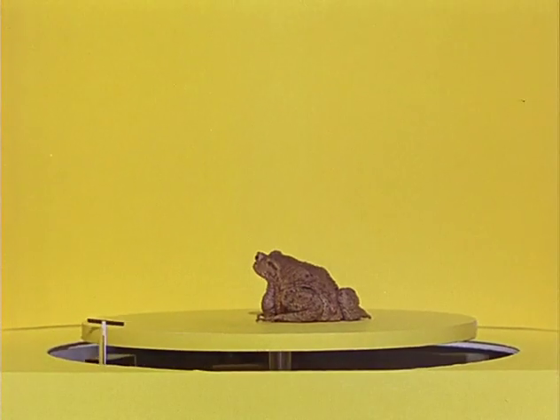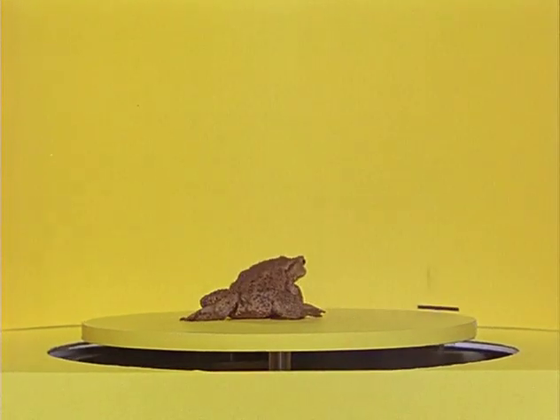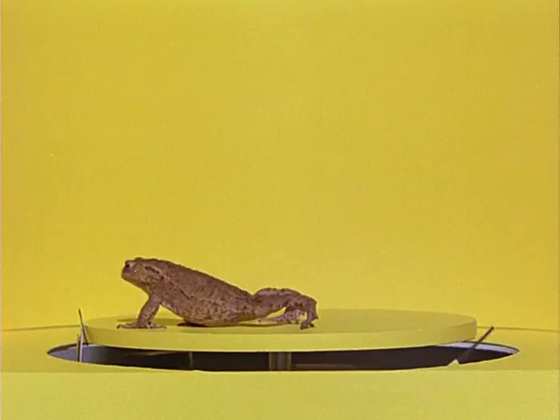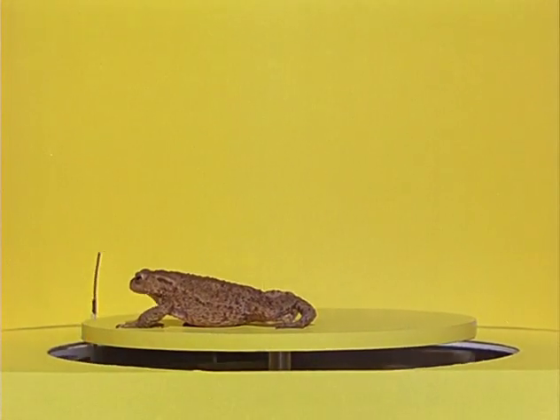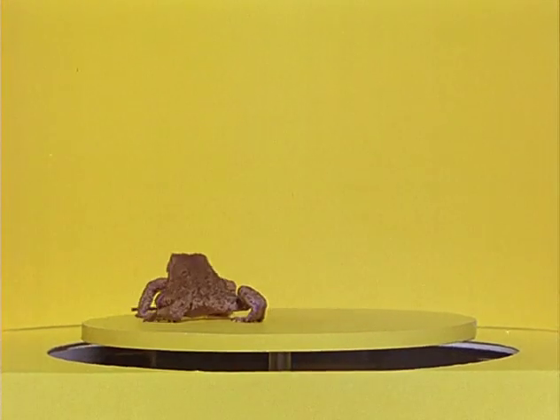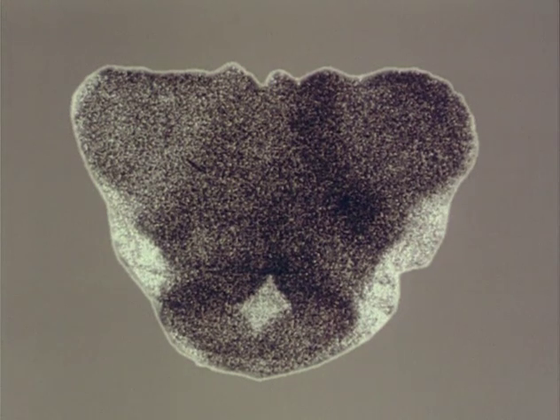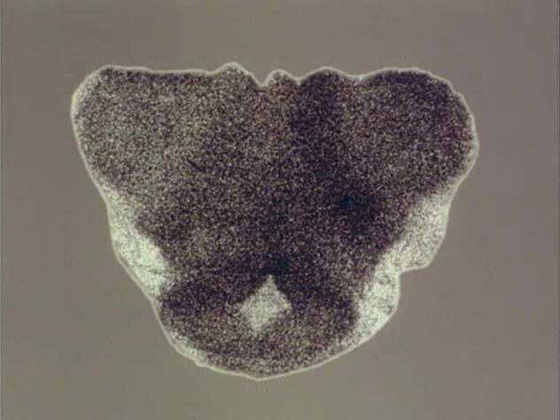There is a method that allows one to check whether visual stimulus patterns evoke different neural activity patterns in the toad's brain according to the hypothesis. If carbon-14 labelled 2-deoxyglucose is applied to the animals, active neurons confuse this radioactive substance with glucose but cannot decompose it. The more active neurons are, the greater the stored radioactivity is. This is the autoradiographic image of a histological transverse section through a diencephalic-mesencephalic brain region of a toad whose left eye was stimulated for a while with an anti-worm stripe.